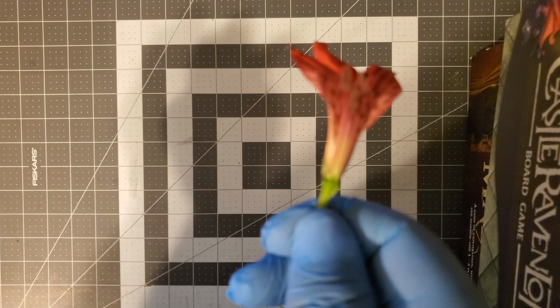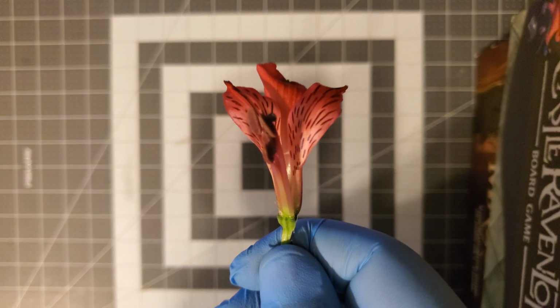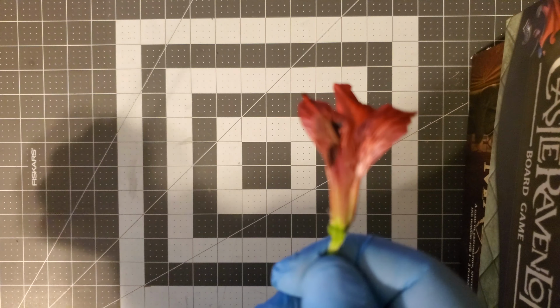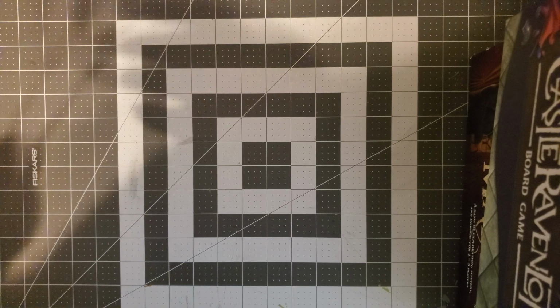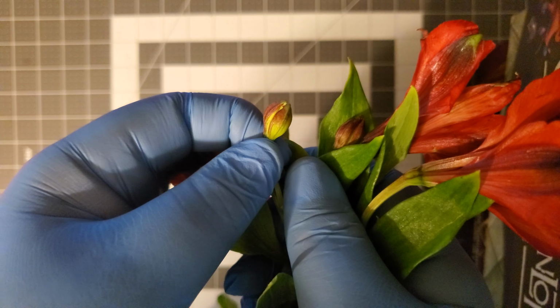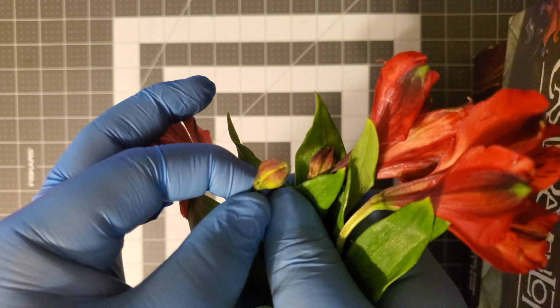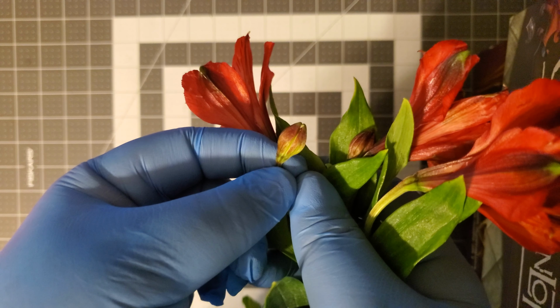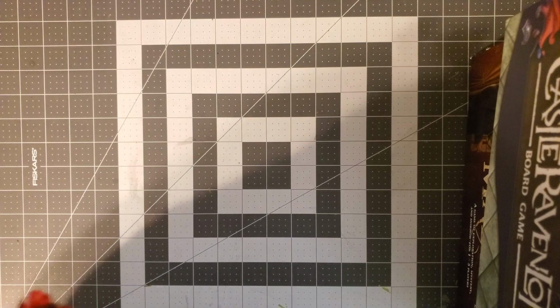One thing, however, which I don't clearly see on the flower right now, is the sepal. I don't see those big leaves that were in the model you showed us online. However, if we go back to the bundle of flowers, you can clearly see the sepals all around when the flower's in the little bud form. So it's protecting the flower, and you can basically see what the sepal's job is, which is pretty interesting. Let's go back to the single flower though.